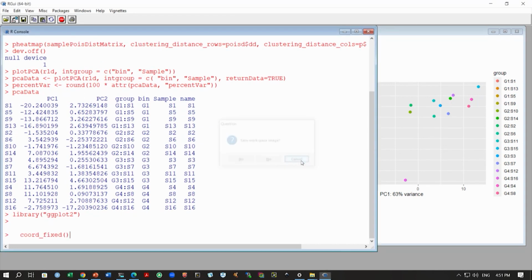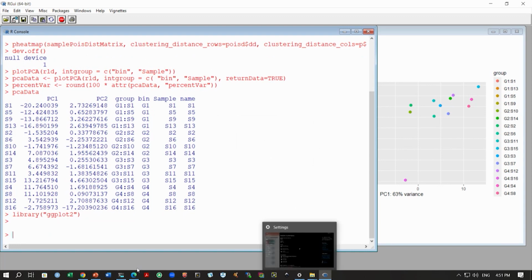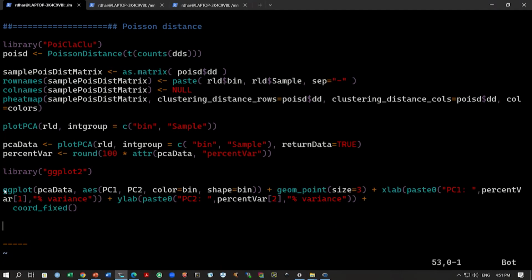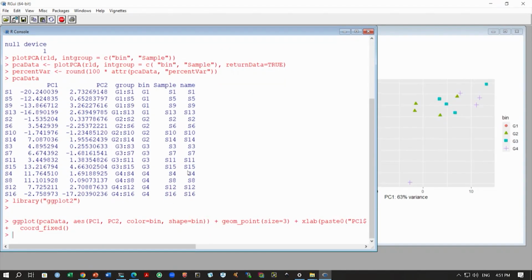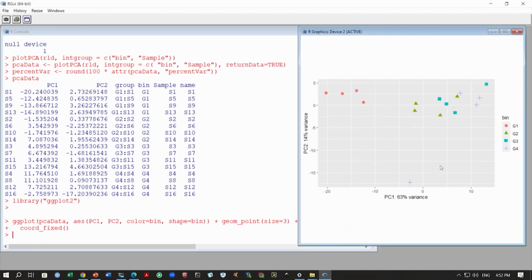What is happening? Okay, no, cancel. So what I'll do is, I think the copying didn't work, so I'll just copy the code again, and I'll run this code here, and you can see now this is actually better, because each group is colored with one single color, and then also the shapes are different.